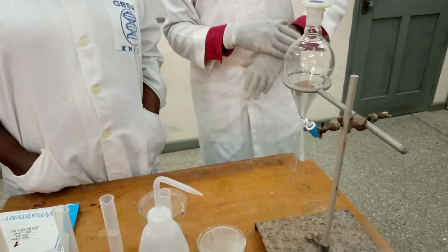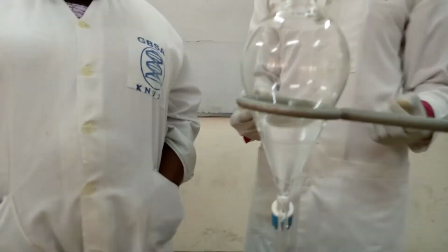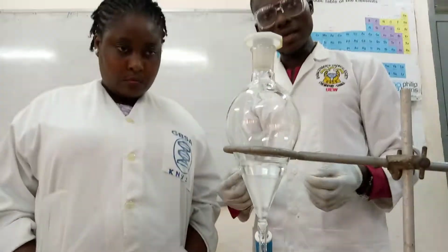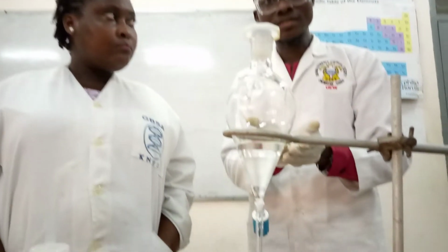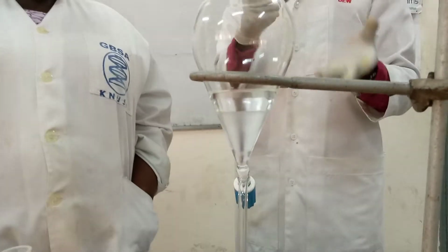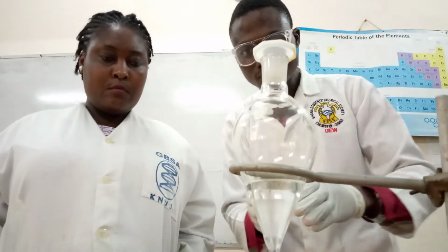Then I'll now wait for a few minutes so that the 2 layers will be separated. And of the 2 layers that are going to separate, the down one will be your aqueous layer, then the top one will be your organic layer. And the down one being the aqueous layer, that is the salt, it means that is salt in water. I mean, that is the benzoate, that is sodium benzoate in water. So that is the salt form. It means that is what the down layer is, that aqueous layer. So that is the salt form, sodium benzoate.